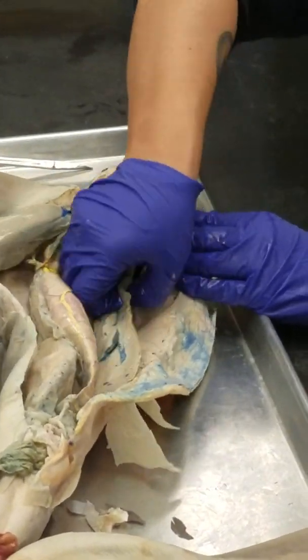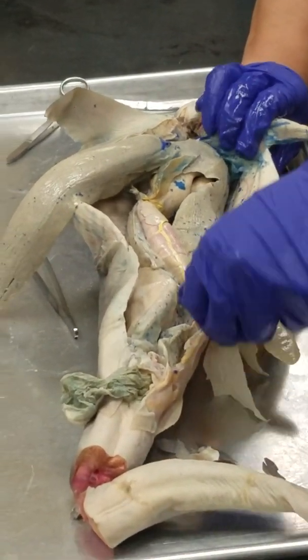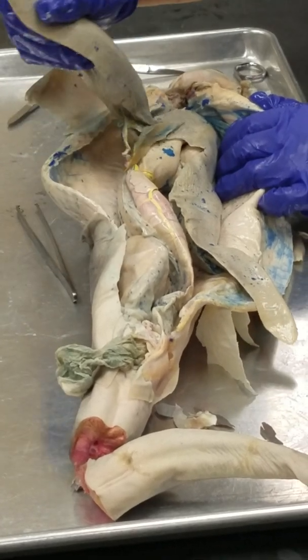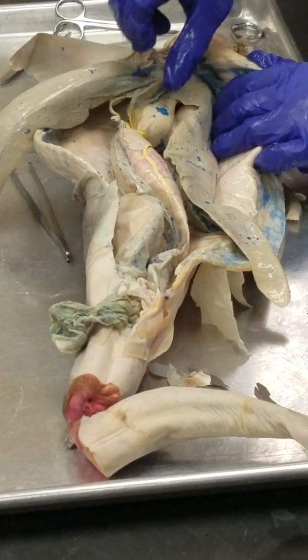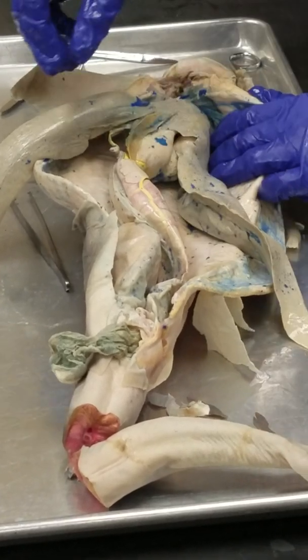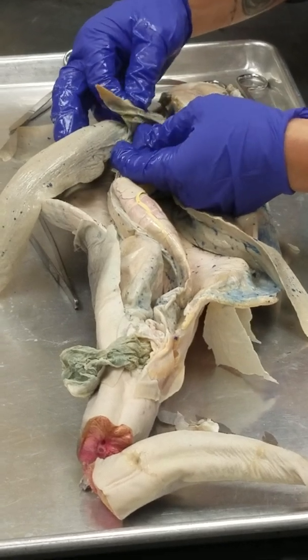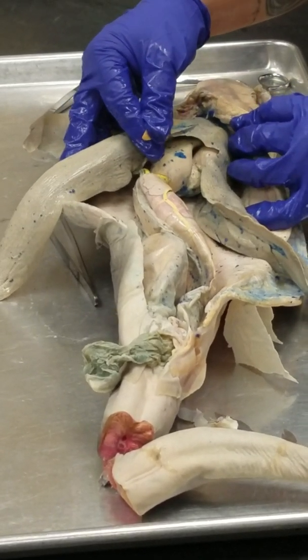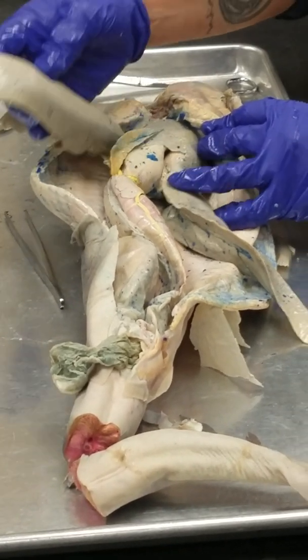Do you guys know? The liver. It's a liver, yeah. So the liver is huge, and the liver has 3 lobes. It has a right lobe, a medial lobe, and then a left lobe. Okay? So this medial lobe, look, it has this stinky green balloon sac here. This is the gallbladder.